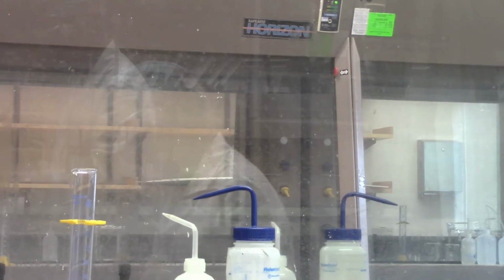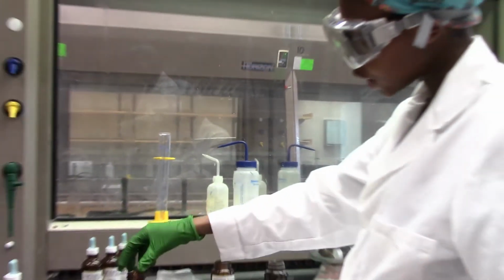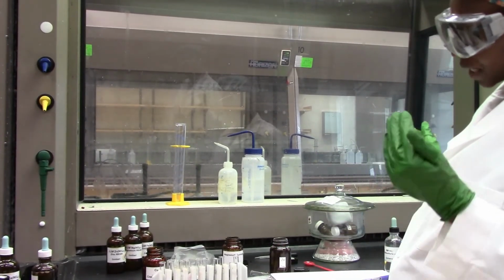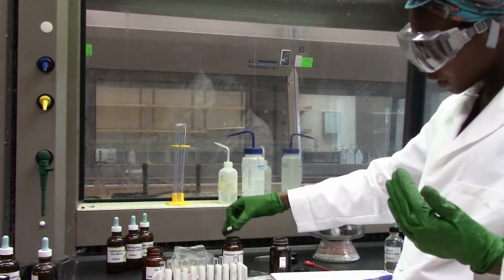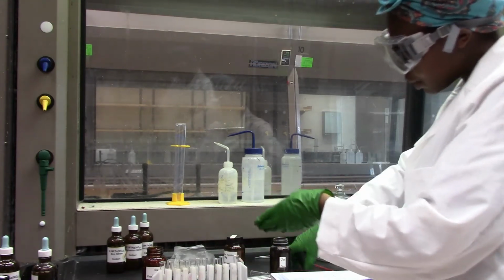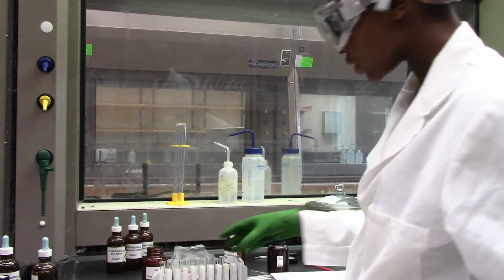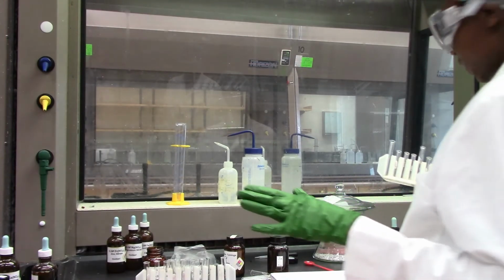Okay. So now based on the different metals we added, there was no reaction when we did copper and iron, but there was some reaction when we added magnesium and zinc. So that tells you that magnesium and zinc would be more reactive than copper. But then between magnesium and zinc, which is more reactive than the other? This is a puzzle that we are going to find out.